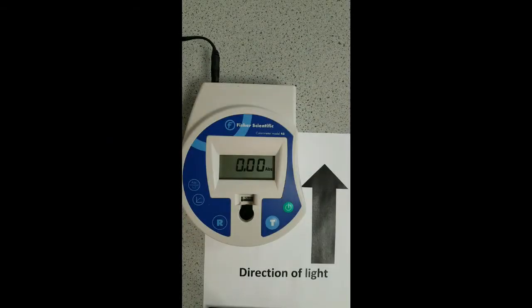Let's set up our colorimeter. Firstly, make sure that the colorimeter is in absorbance mode, which it is as you can see on the display there.